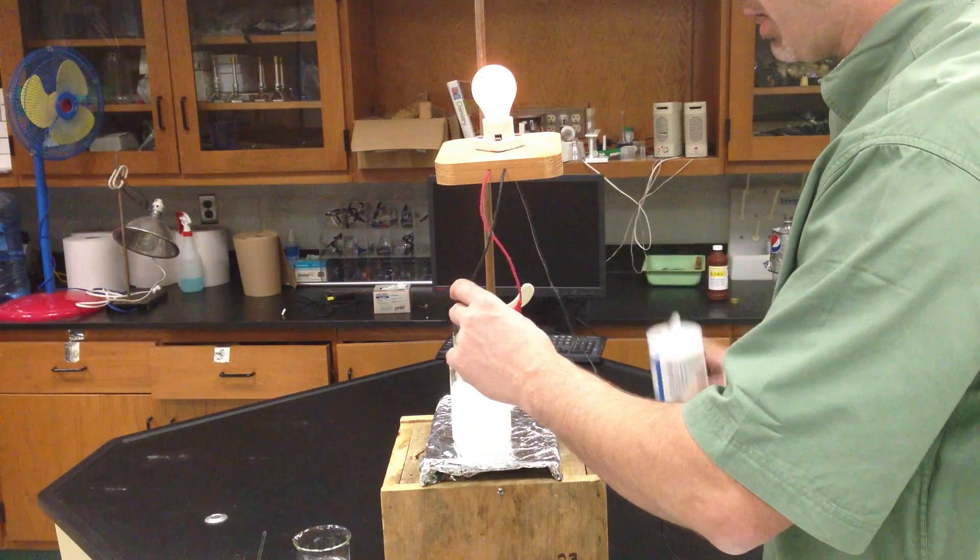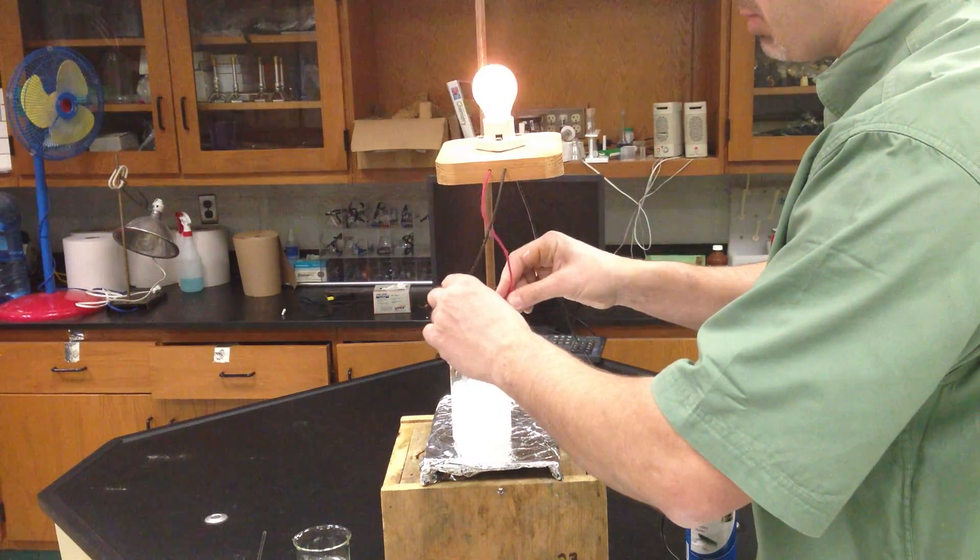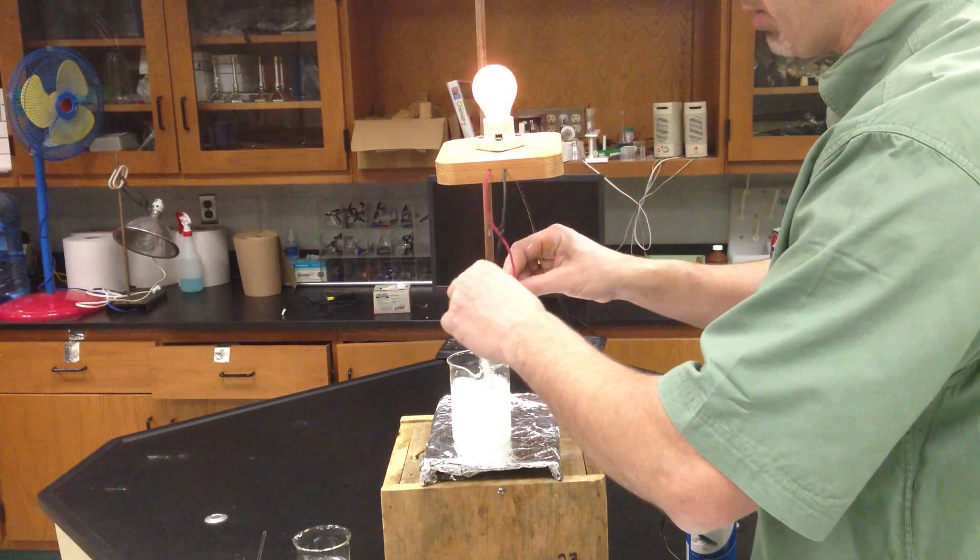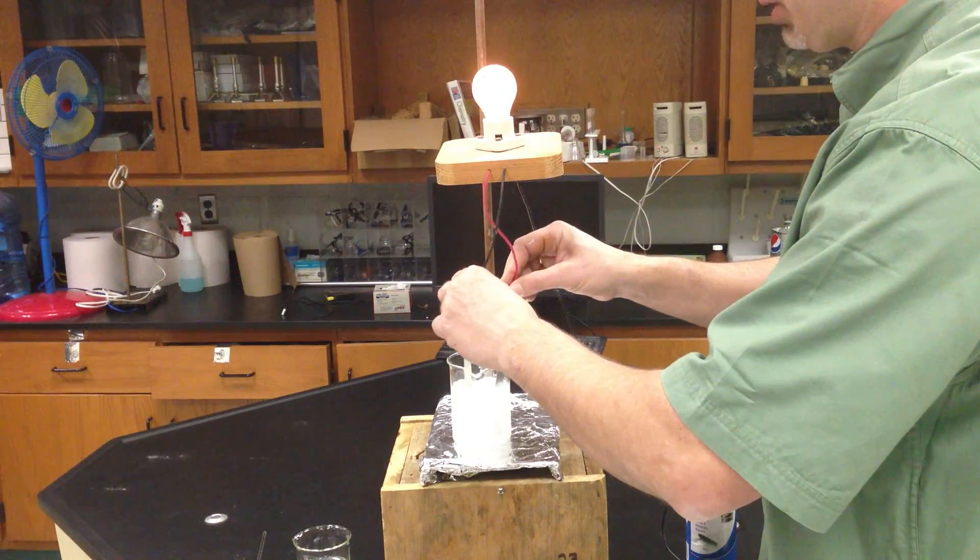And the light bulb is somewhat getting brighter, and I have to mix these. So as I mix them, that light bulb should get a little bit brighter until I get to the solubility point.